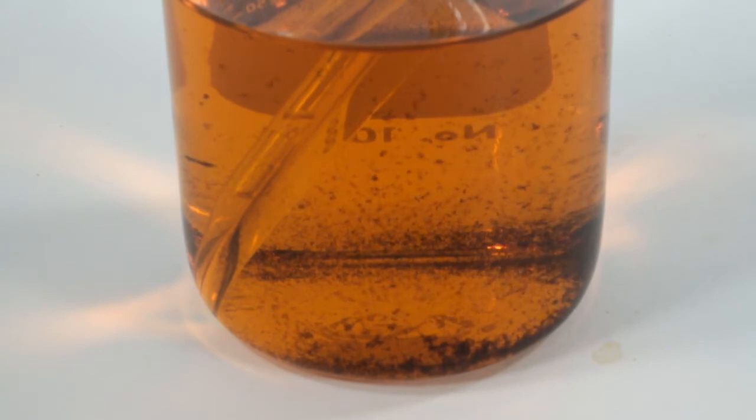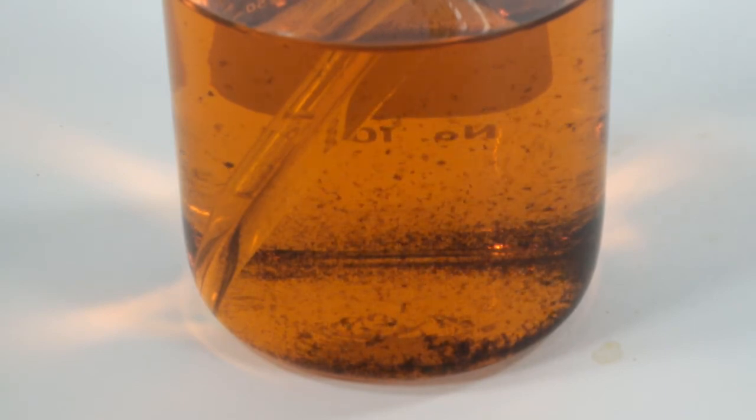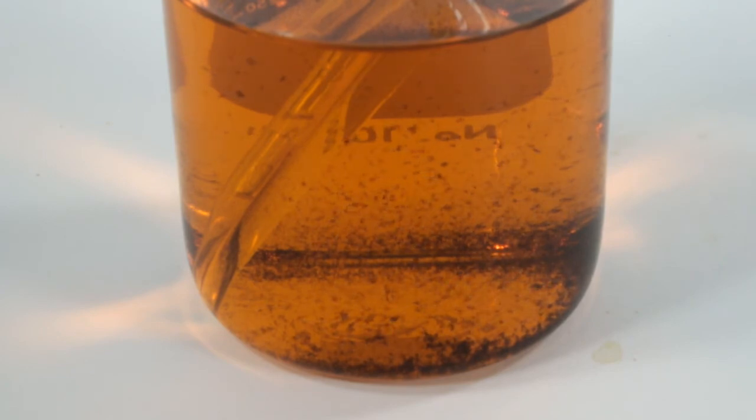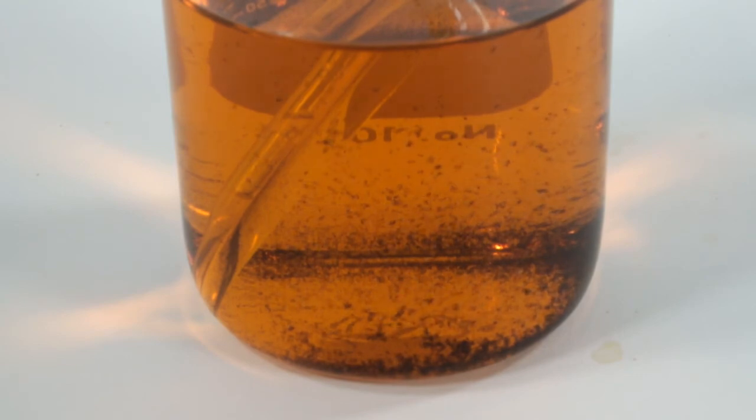Another interesting observation, I didn't dump the beaker with the freshly prepared solution either. And in a week, left uncovered, it did grow the same junk. In the future, I'm going to prepare this solution as needed.